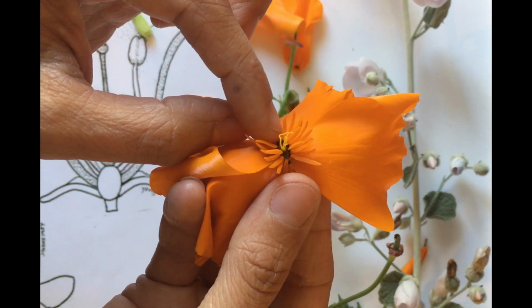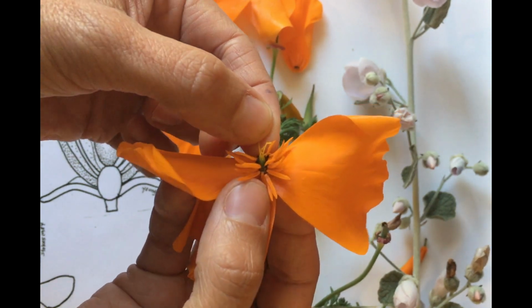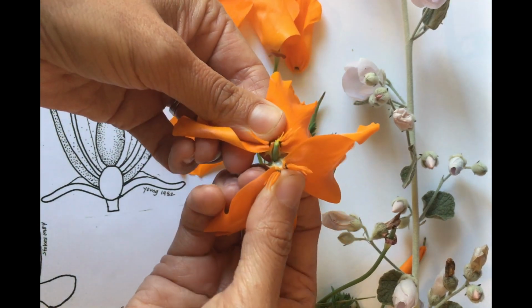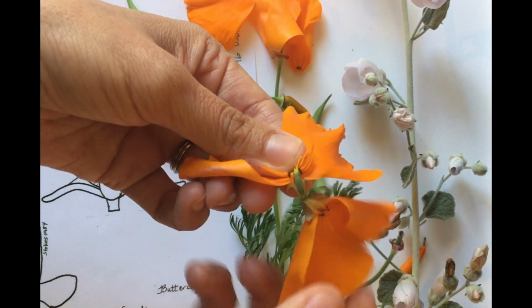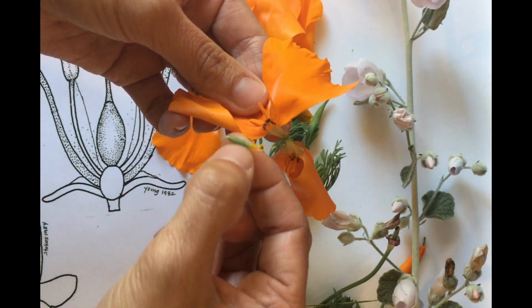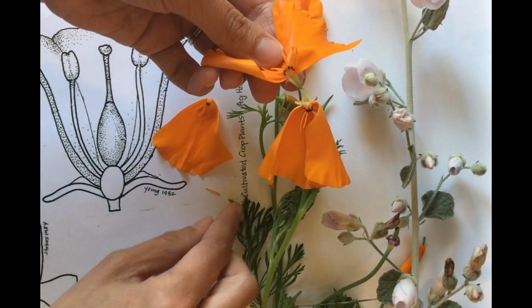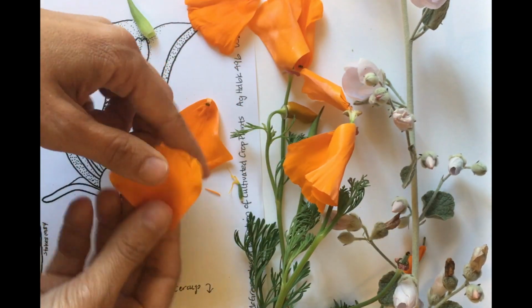If you're following along, go ahead and open up your flower. When I open it up, you'll see a thick green part. This green part is the ovary, where the ovules are found, that will eventually create a seed to grow more poppies. It's amazing to think what goes into creating a new flower. Pollinators like bees, beetles, and butterflies flying around, bringing pollen to and from flowers.